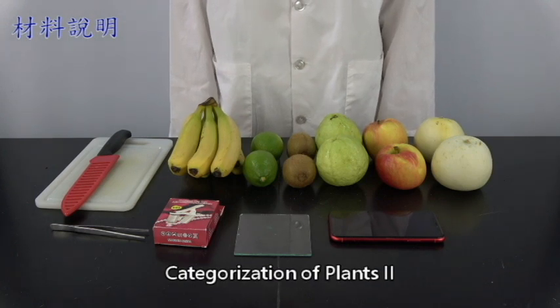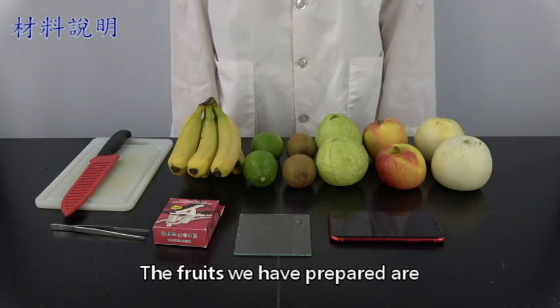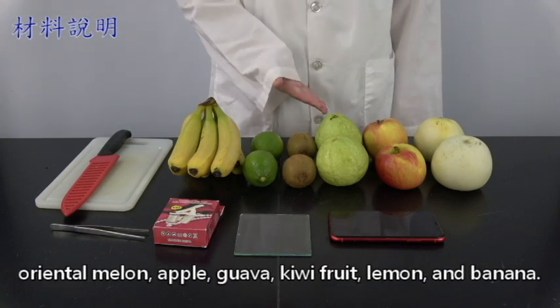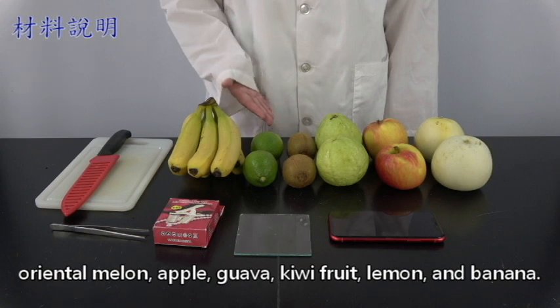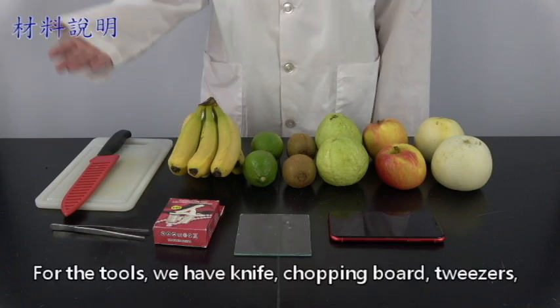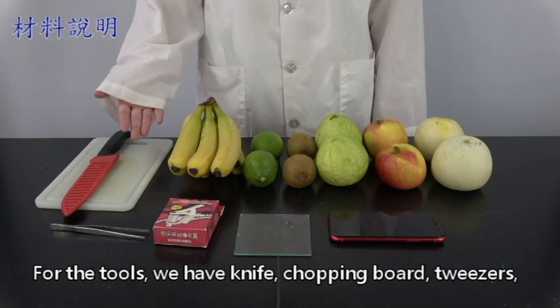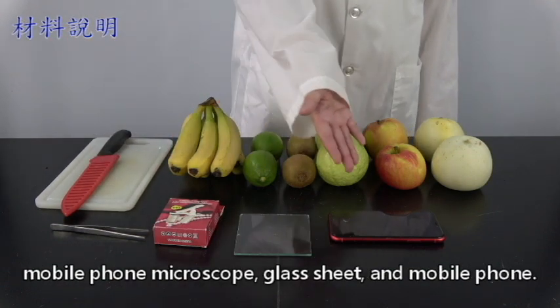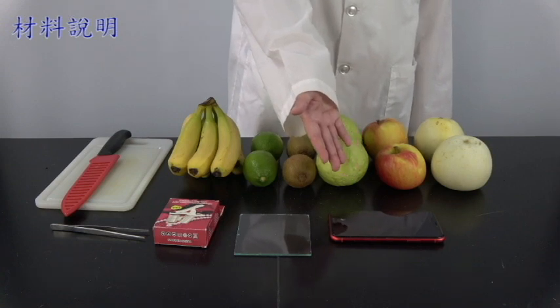Experiment 2. Categorizations of plants. The fruits we have prepared are Oriental melon, apple, guava, kiwi fruit, lemon, and banana. For the tools we have knife, chopping board, tweezers, mobile phone microscope, glass sheet, and mobile phone.